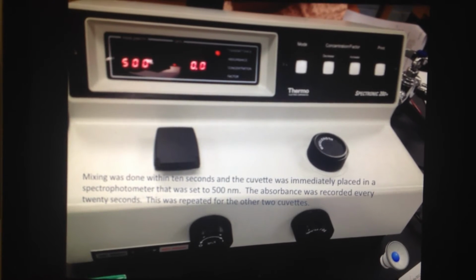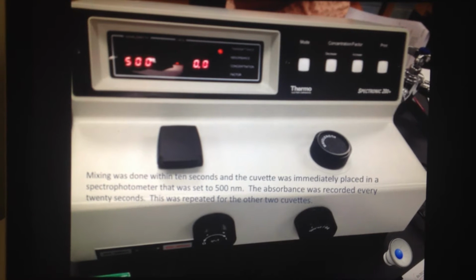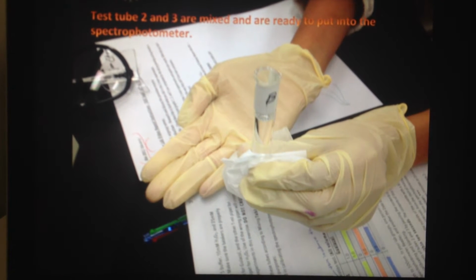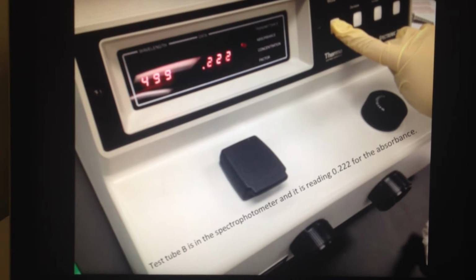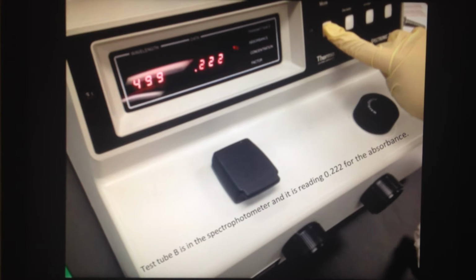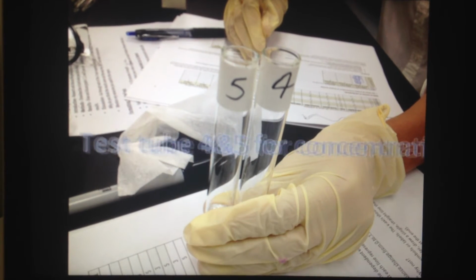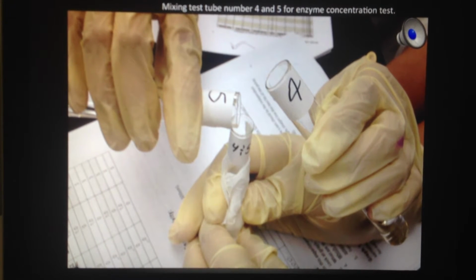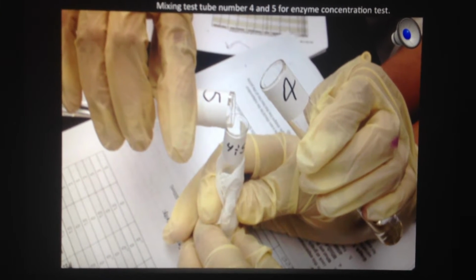Mixing was done within 10 seconds, and the cuvette was immediately placed in a spectrophotometer that was set to 500 nanometers. The absorbance was recorded every 20 seconds, and this was repeated for the other two cuvettes. This was the method used for all of the cuvettes. Two test tubes were mixed in one cuvette and then placed in the spectrophotometer, and absorbance was recorded every 20 seconds.